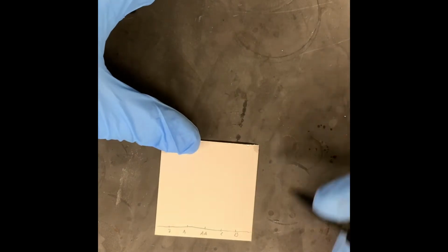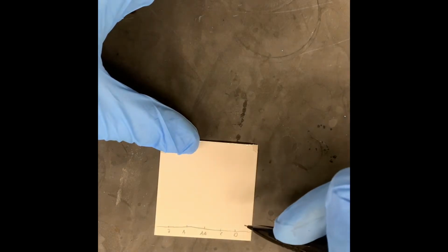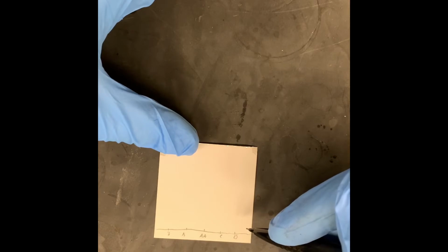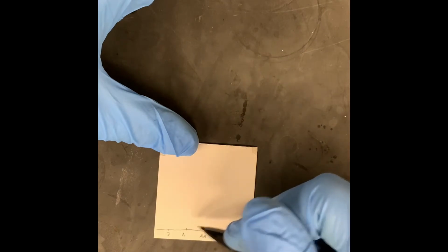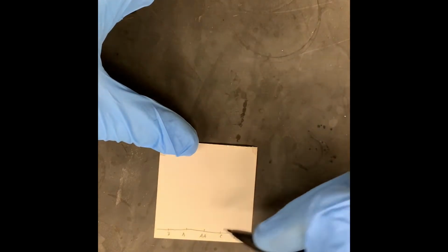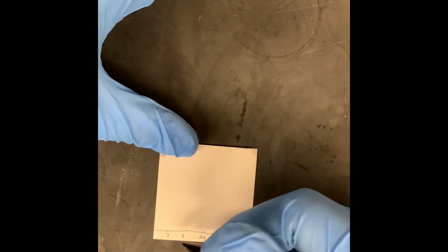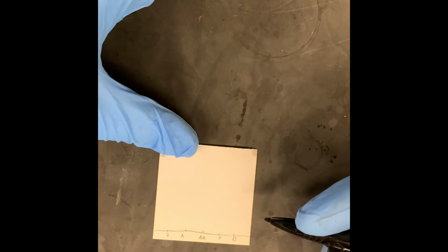So what we're going to do is take a much larger TLC plate. Again, we draw our baseline across the bottom of the TLC plate. And this time we're actually going to run 5 samples at once on the same TLC plate. And so what we do is we create these different lanes. We draw a tick mark spaced apart from another tick mark, and we label it with some sort of letter or number. And so the first tick mark that I drew, that's where we're actually going to spot unknown number 3. The second one, which I drew as letter A, that represents acetaminophen.